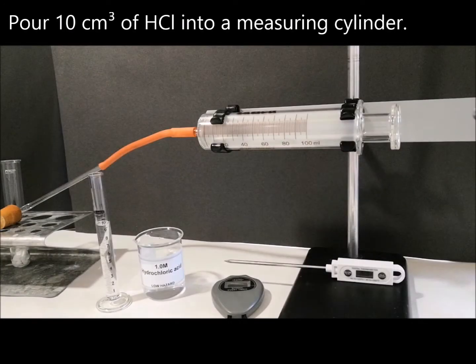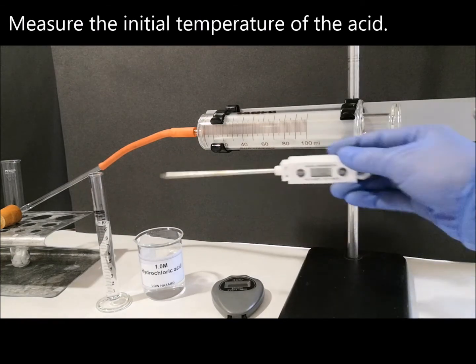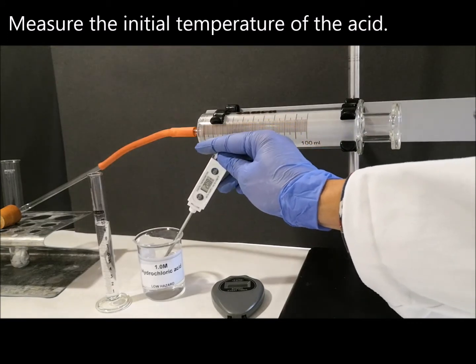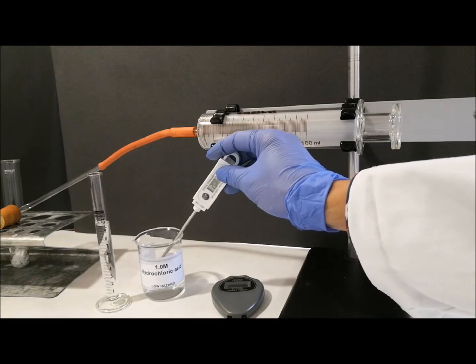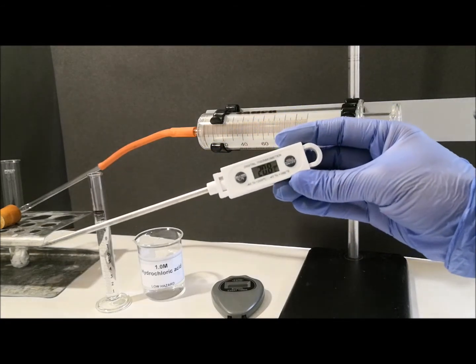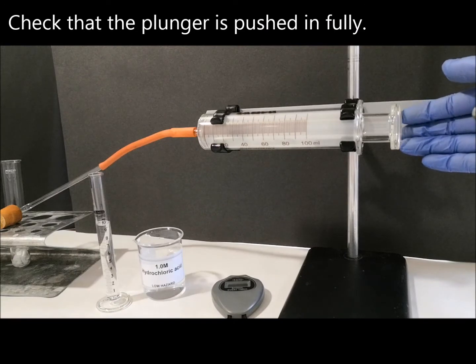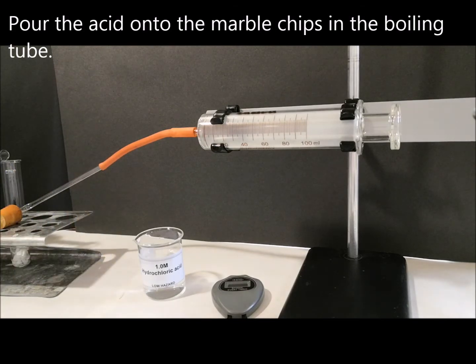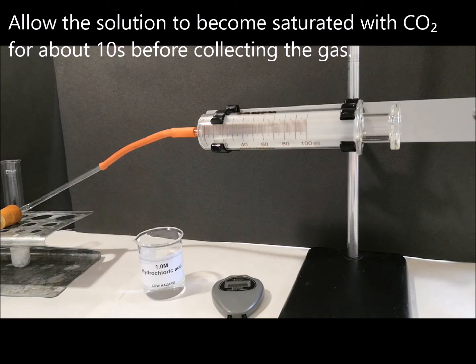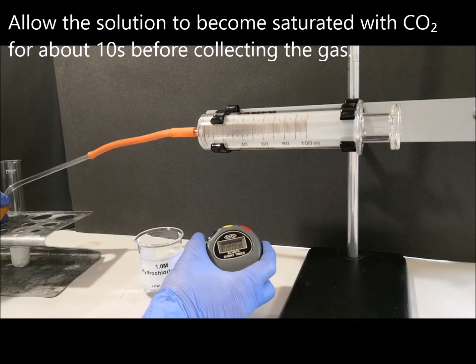Pour 10 cm³ of HCl into a measuring cylinder. Measure the initial temperature of the acid. Check that the plunger is pushed in fully. Pour the acid onto the marble chips in the boiling tube. Allow the solution to become saturated with carbon dioxide for about 10 seconds before collecting the gas.